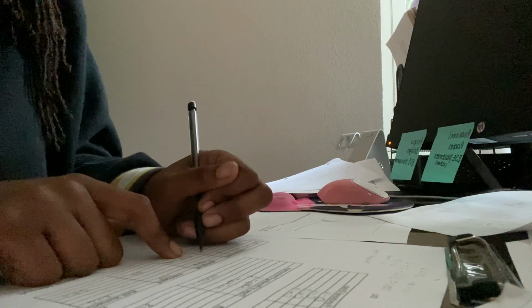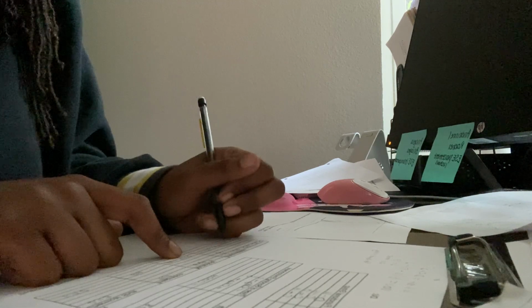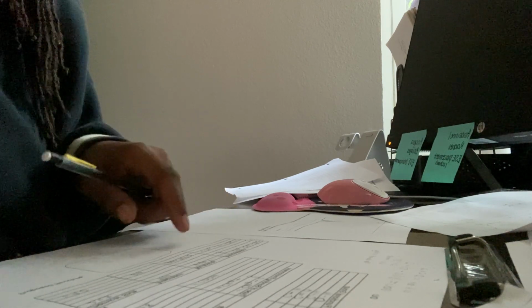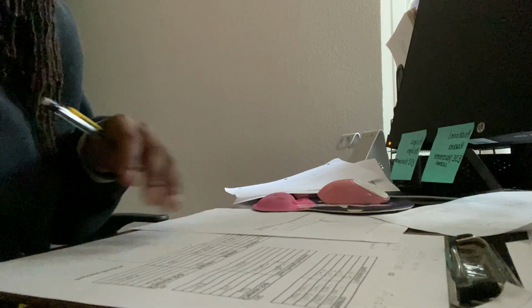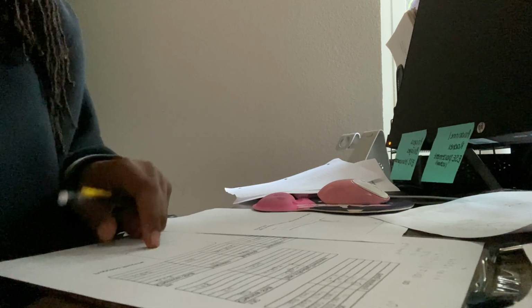Pentet. And I know this is CH2, CH2, CH2. So if you don't know anything else, you know that methyl has to be very prominent in this structure. Now that we have all of this together, I now can propose a structure.